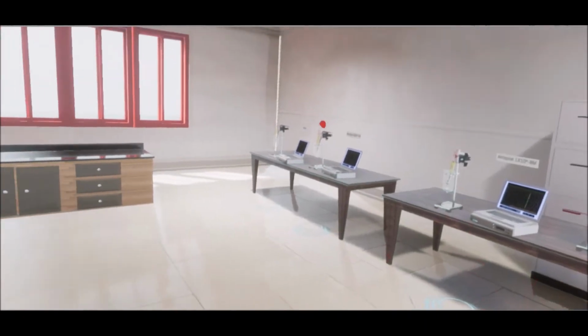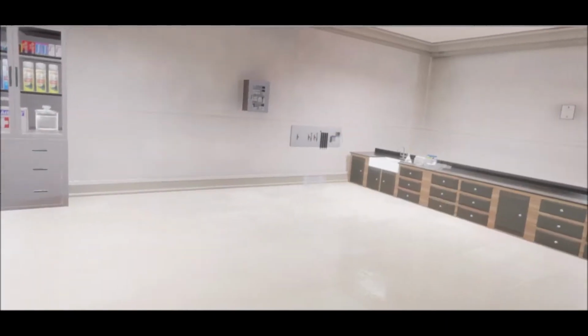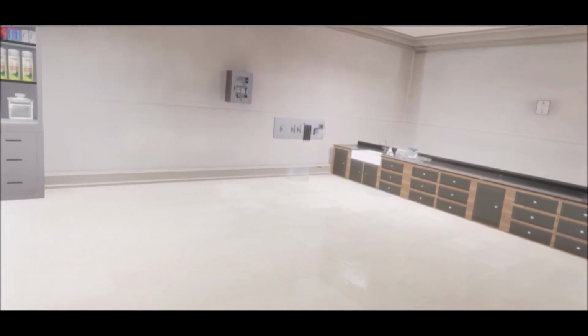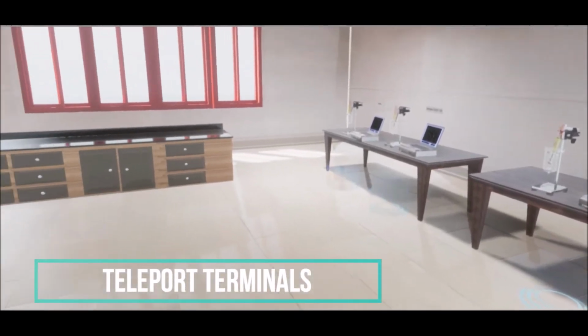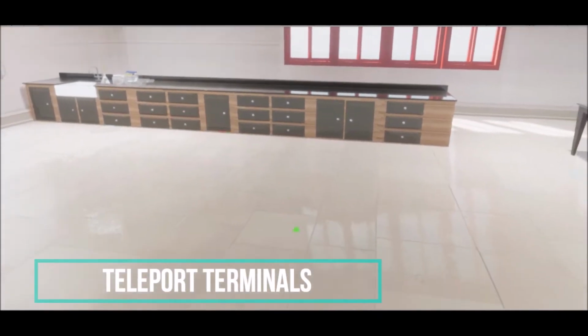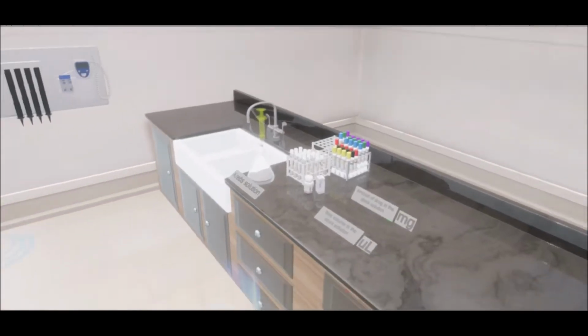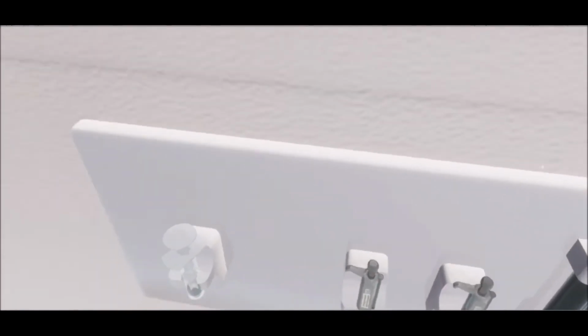This virtual reality lab is created based on a biomedical sciences lab practical class which uses the organ bath setup. The organ bath technique allows students to study how drugs act in the biological systems. In this VR lab, we simulate the response of drugs called carbachol and atropine using the rat airway tissues.